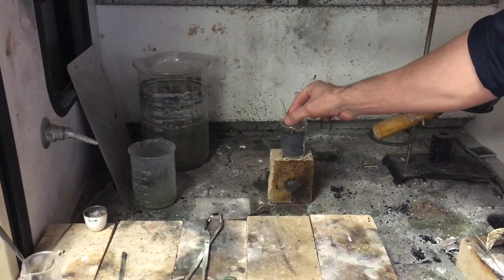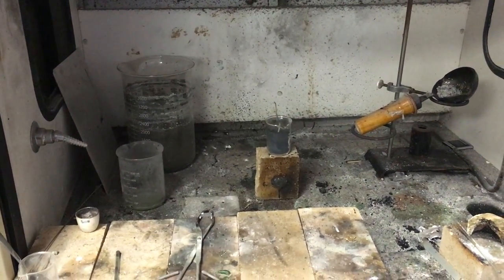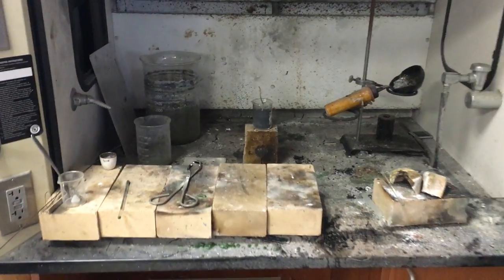So we get a little fuse, and I hope this goes off like it did in the first period. And you're all going to want to back up.